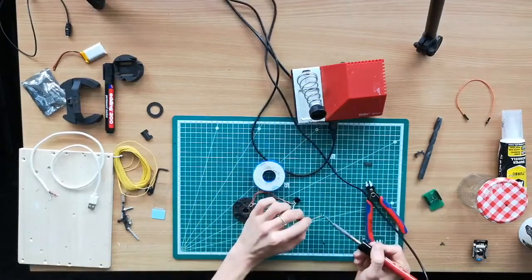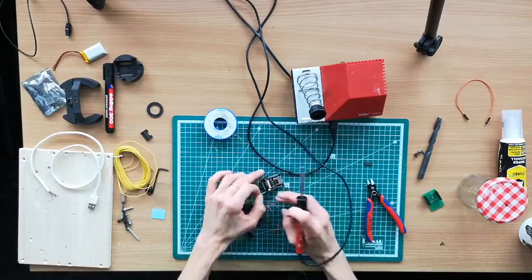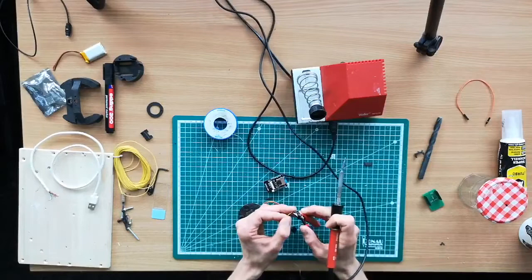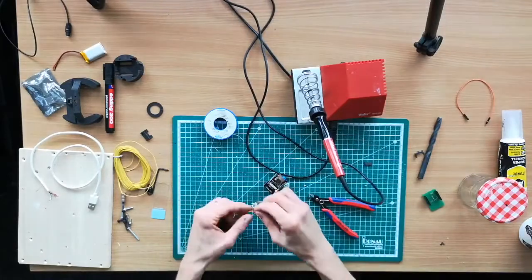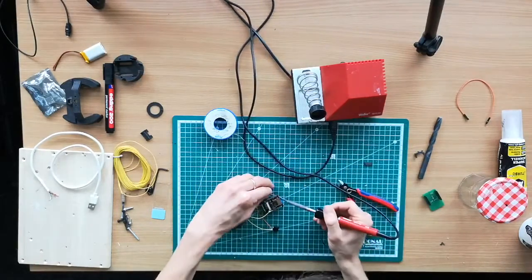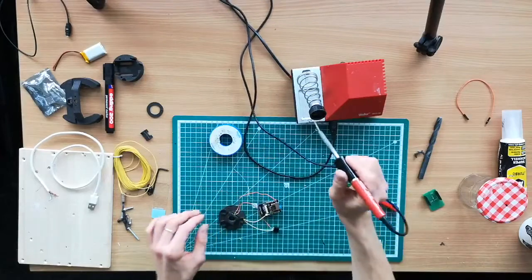So then this here connects to the ground of your camera. So there are multiple ground connections. It doesn't really matter which you use, and we can directly do that on top of the device. Make sure that you don't form a short circuit. So that's how it goes. The ground. And also this here goes to plus 5 volts. And the 5 volts, for example, right here. Always make sure that it's a proper connection, so it's not a cold joint which eventually breaks over time.